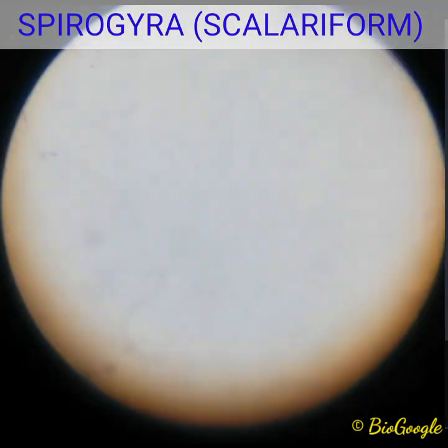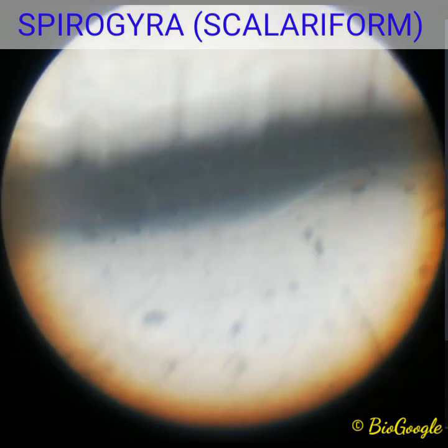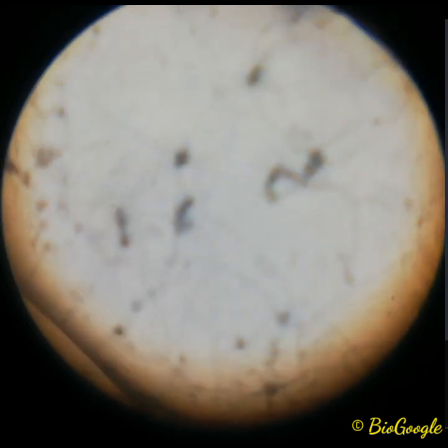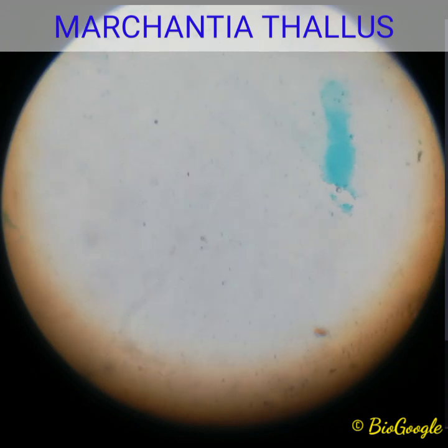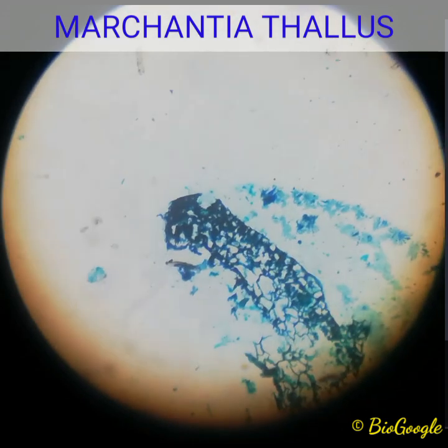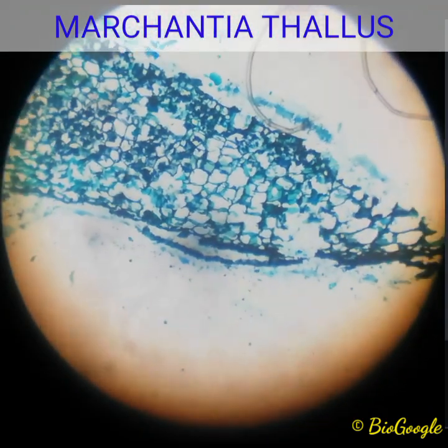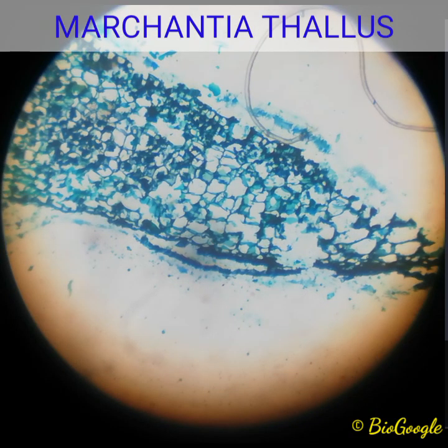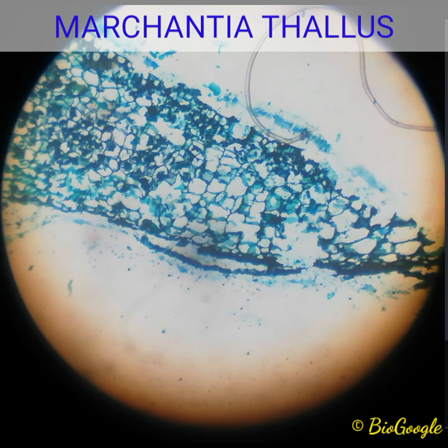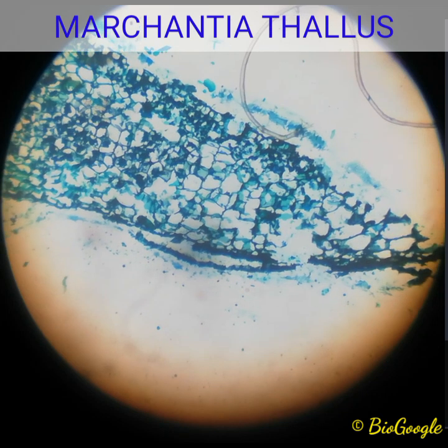Moving on to the next slide: that is a Marchantia thallus, one of the bryophytes. That is Marchantia. In this slide, we will see the thallus of the Marchantia. It is the thallus of the Marchantia — one of the bryophytes. Hope you remember the examples of bryophytes: Riccia, Marchantia, and so on.